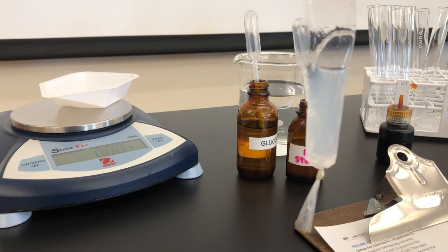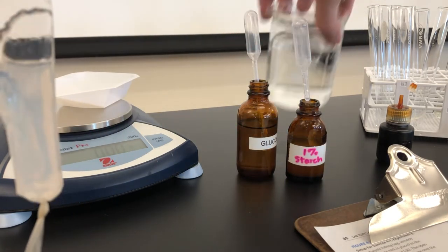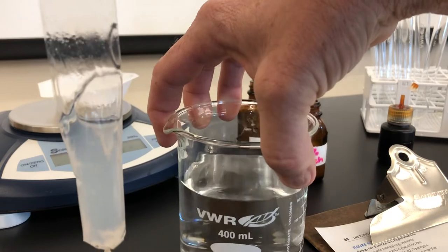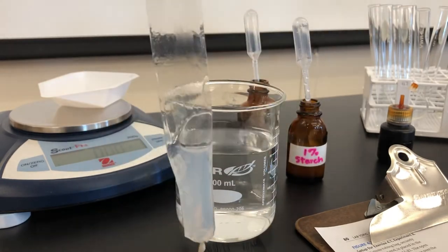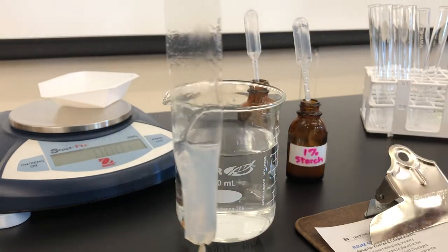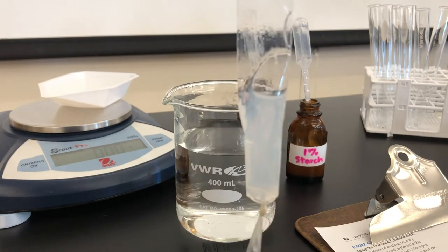Now the color of the bag and the color of the beaker in which we're going to soak this simulated cell need to be recorded in table 4.1 on page 80.